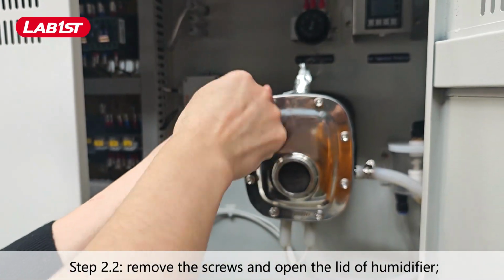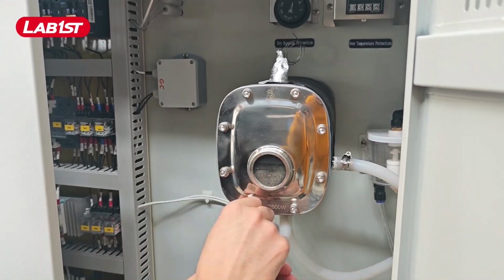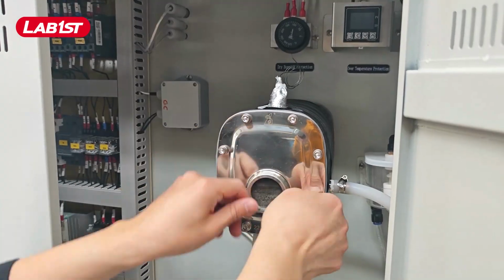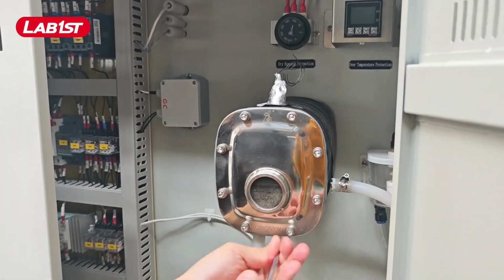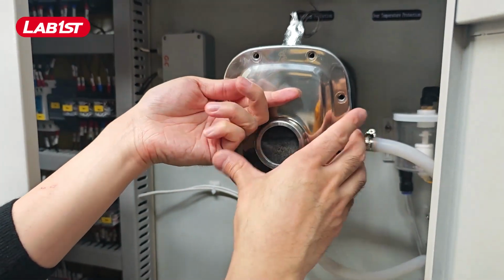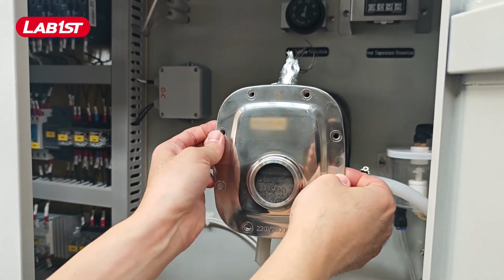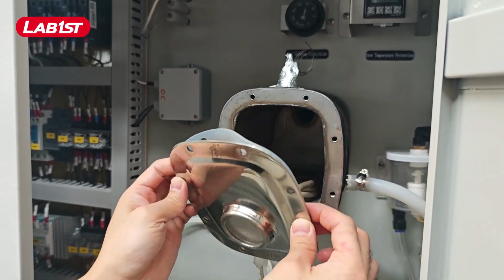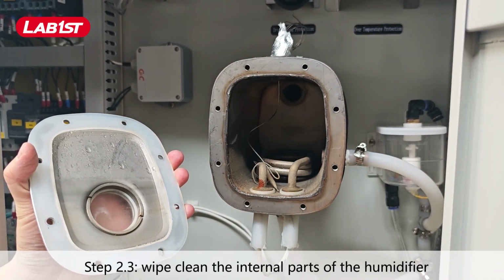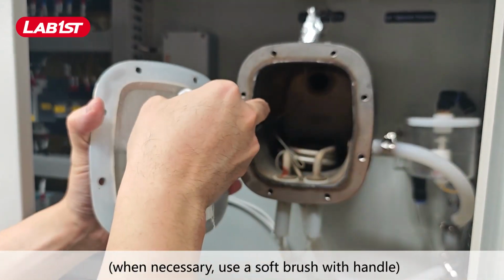Step 2.2. Remove the screws and open the lid of humidifier. Step 2.3. Wipe clean the internal parts of the humidifier. When necessary, use a soft brush with handle.